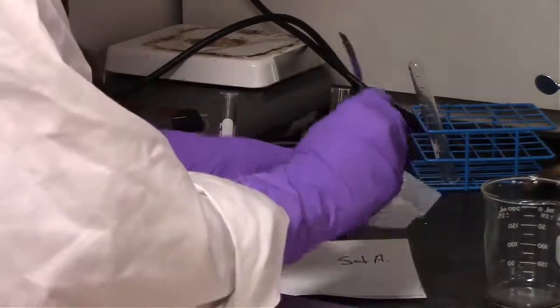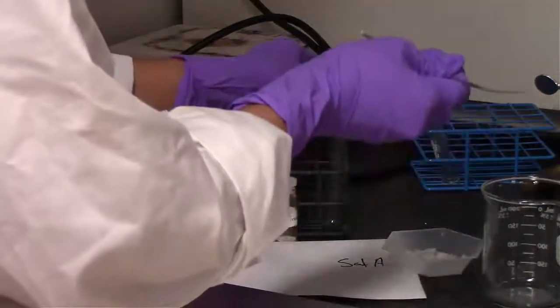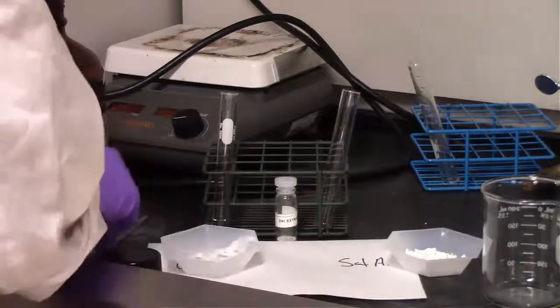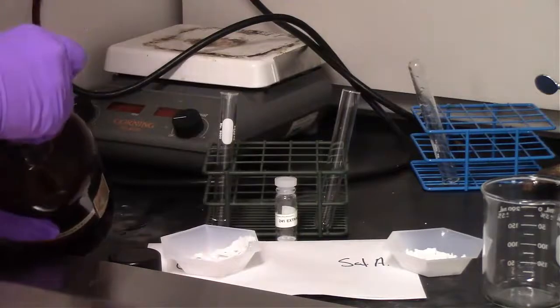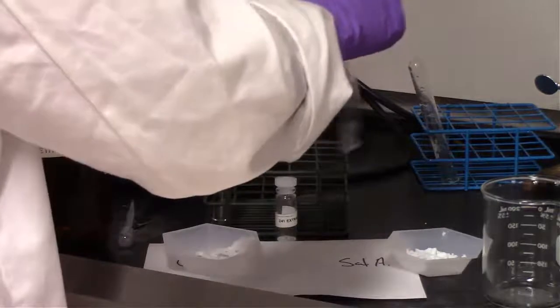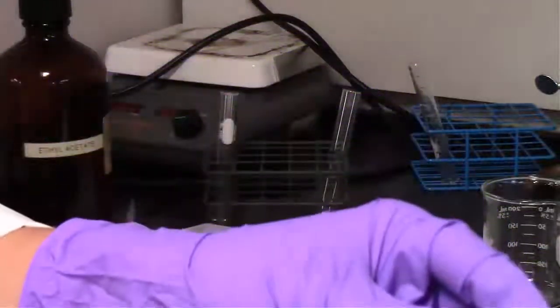For salicylic acid, this is 100% salicylic acid here. We found out from the melting temperature that it's pretty pure, so I think if we just use a little bit of that, we might be able to get by with it. But again, that was a pretty tiny amount, so I would say, again, probably about 5 times that amount. If you just take one tiny spot on the plate, you can always check it, and if you're still a little bit low, you can always respot. Now, it's good not to overload it though, so you wouldn't want to take a huge spatula tip and dump it in there, because if you overload it, you can't just spot again to add more. You've already overloaded it, and your plate's not going to run very well.